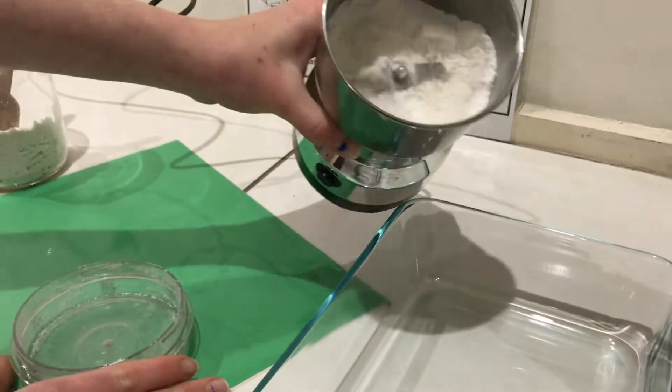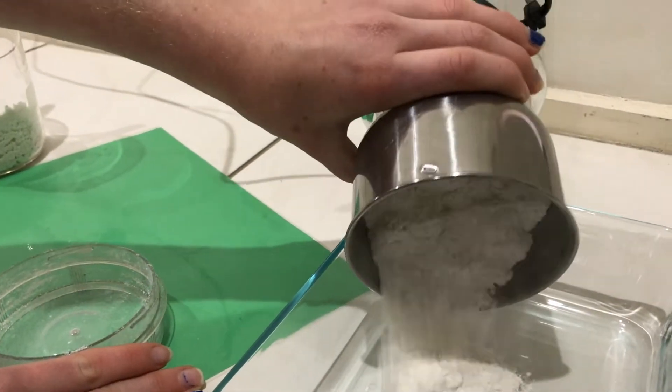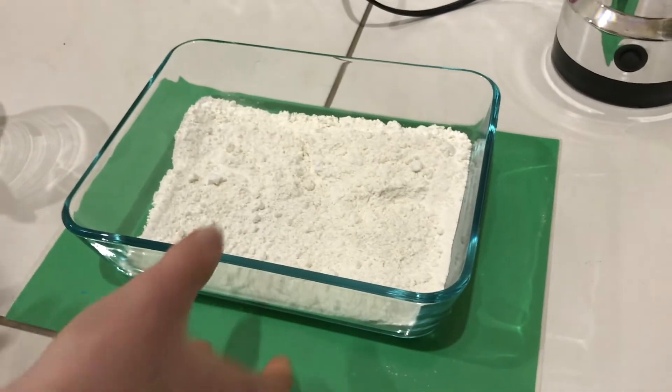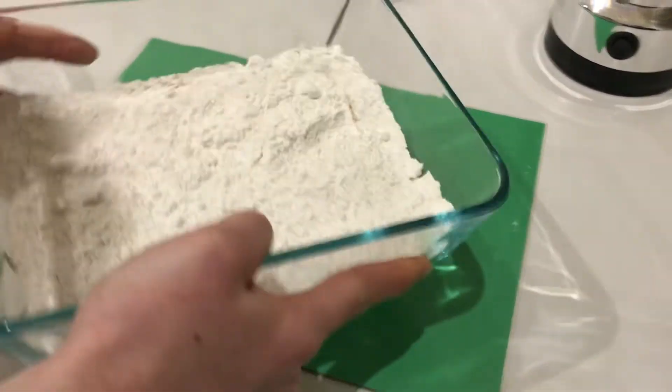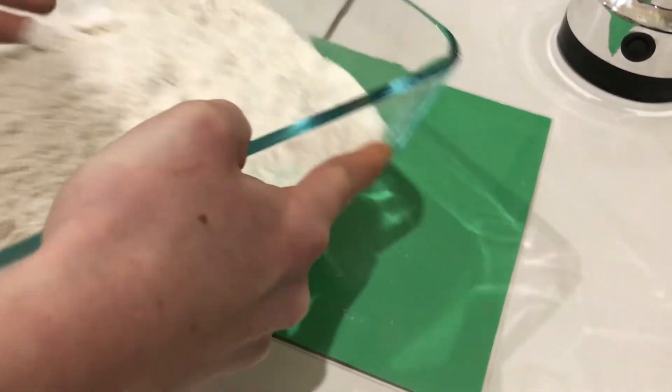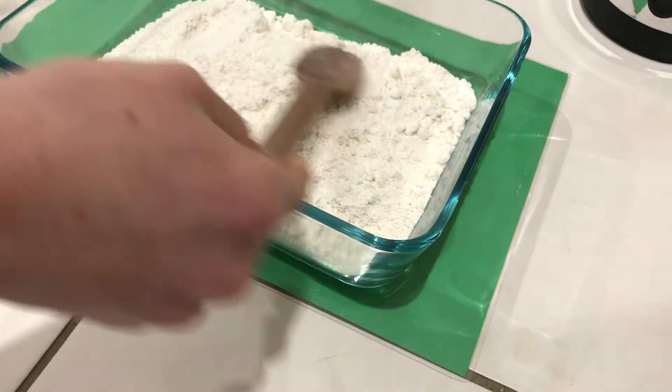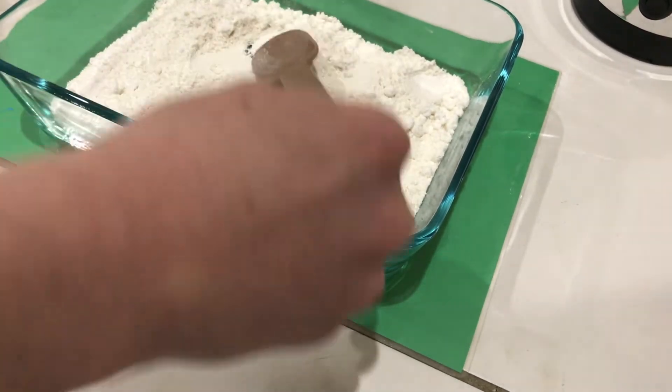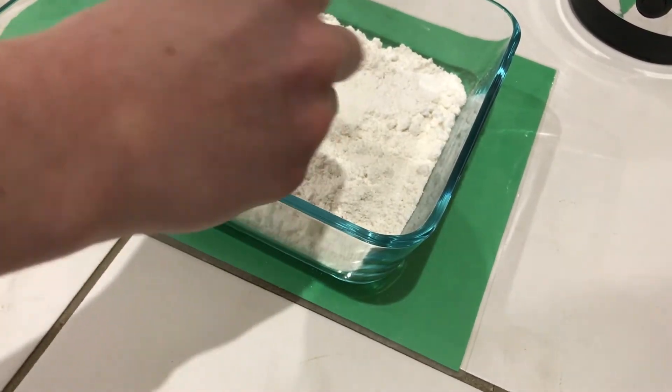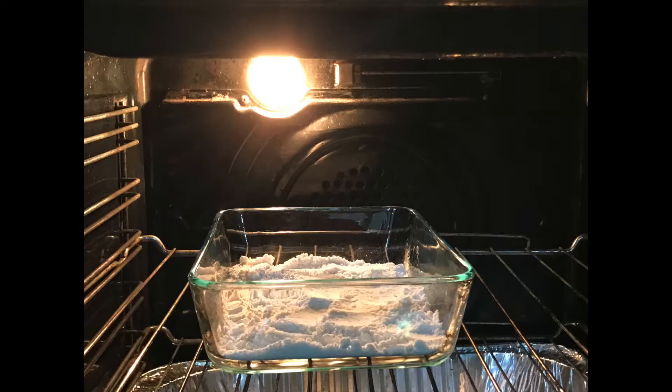I did this blending process in multiple batches, but only recorded the first batch. I am now just going to shake around the calcium acetate to make sure it is evenly distributed. Then I put it in the oven for around 2 hours at approximately 120 degrees Celsius, because I factored in that calcium acetate decomposes at 160 degrees Celsius. I put the acetate in the oven to evaporate any water, since calcium acetate is extremely hygroscopic.